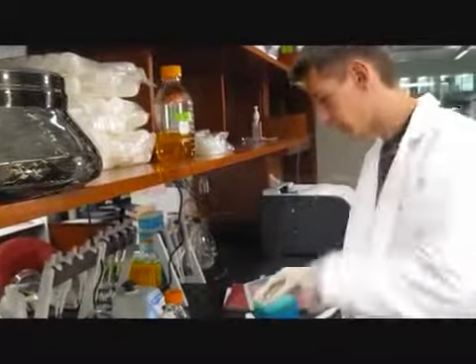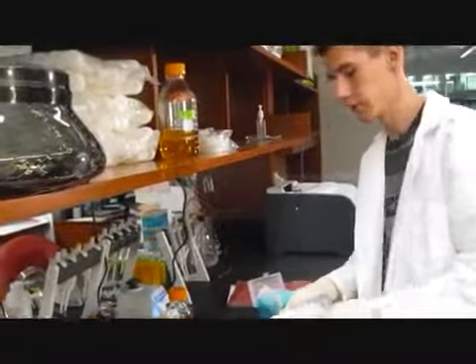So we have these guys ready now. We're going to take them and shake them.